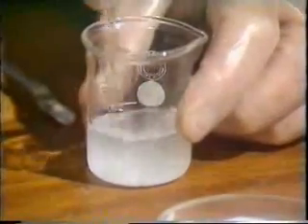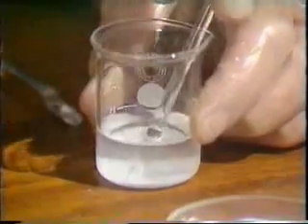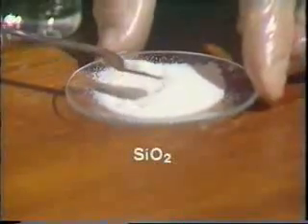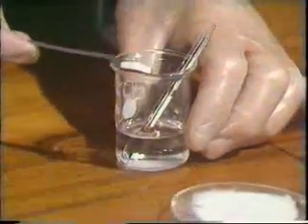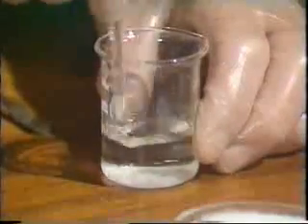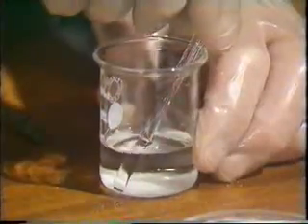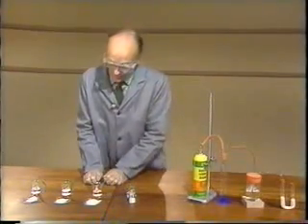And again, even on stirring, there doesn't seem to be any sign of the aluminium oxide dissolving in hexane. Now we'll try silicon dioxide. And once again, even after stirring, there's no sign of the silica dissolving. So this compound dissolves neither in water nor in hexane.